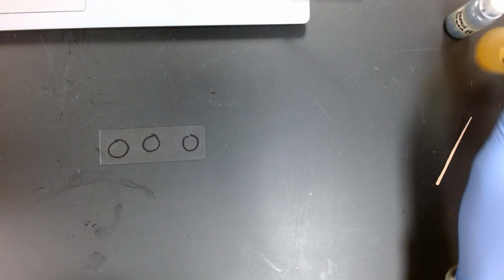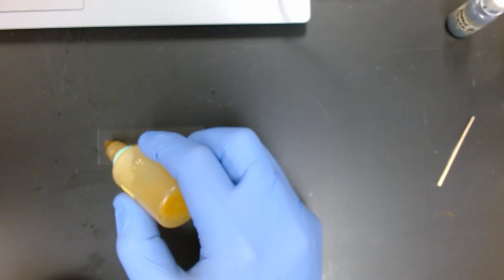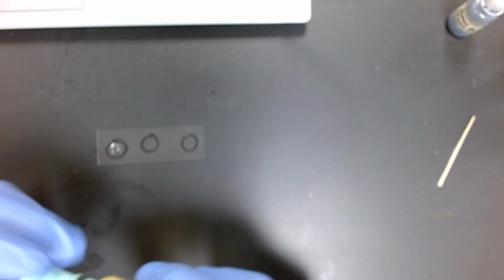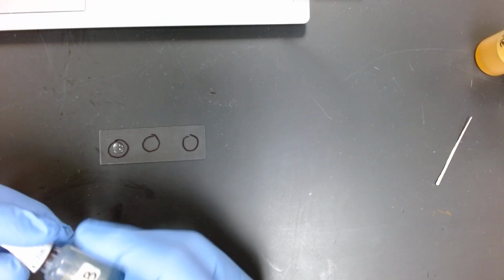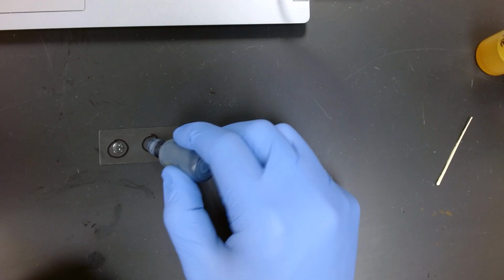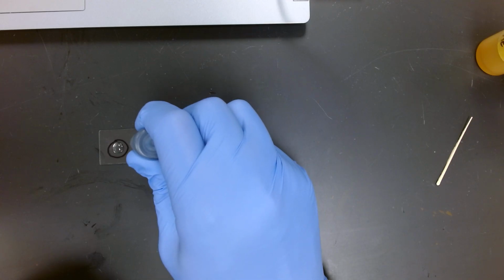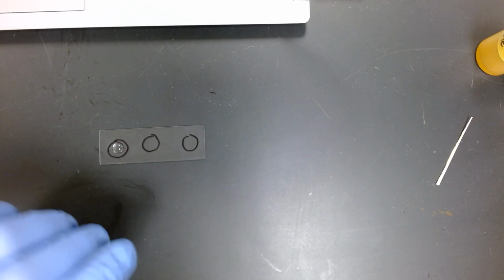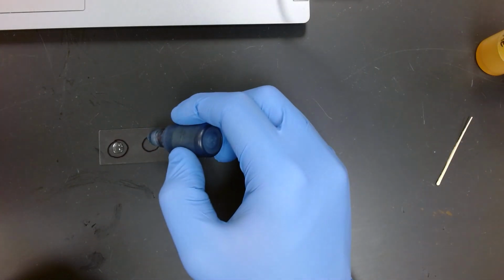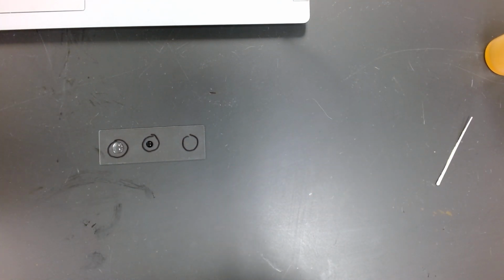Then we'll come back and we'll drop some different stains on it. So we'll go with the iodine stain, and we just want to put 1 drop on there. We can come back with the Janus green stain, another drop as well. Well, this one might be about empty. Here we go. This one is not empty. So we'll drop a Janus green on there. And then finally we will drop some fast blast stain on our cells.